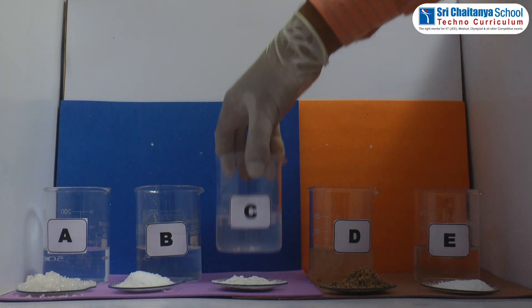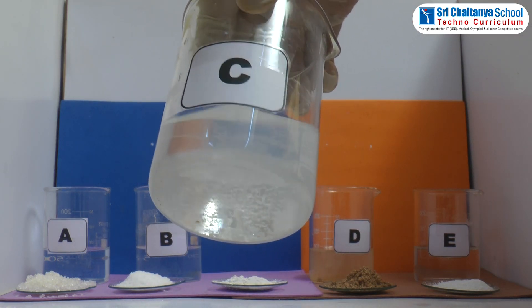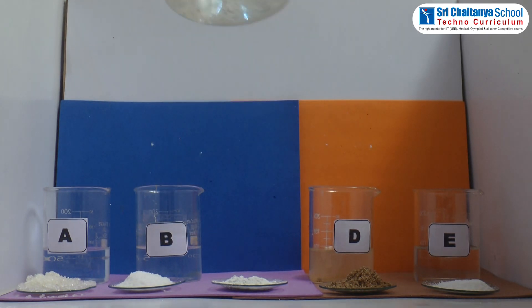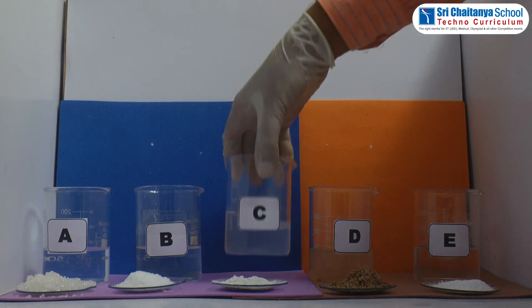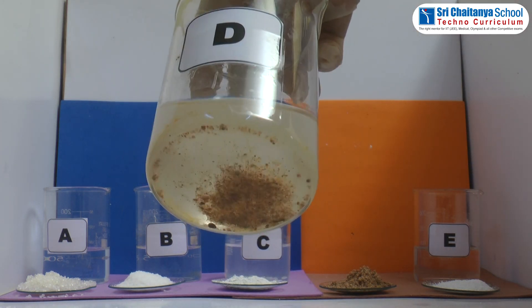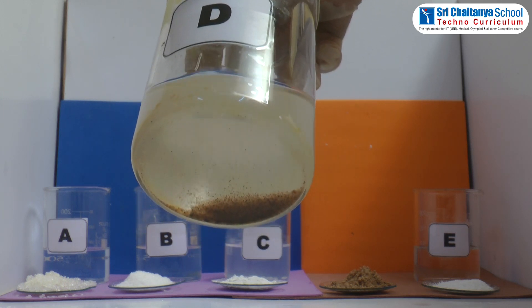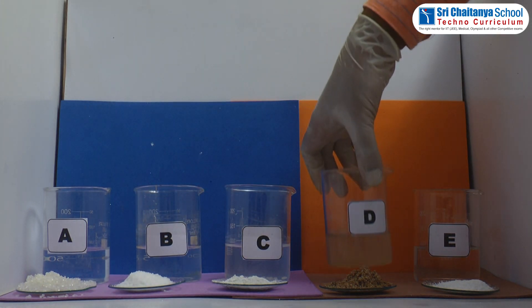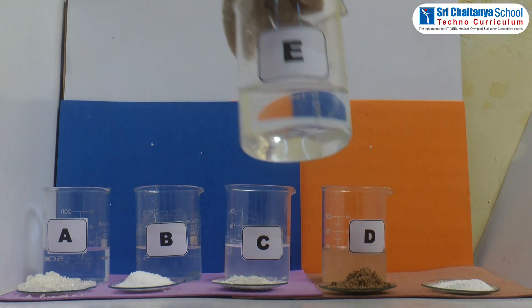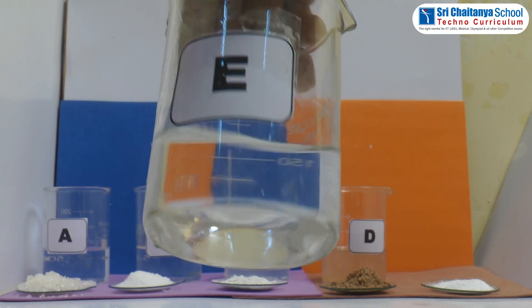In beaker C, chalk powder is insoluble as it does not disappear. In beaker D, sand is insoluble as it does not disappear. In beaker E, washing soda is soluble as it disappears completely in water.